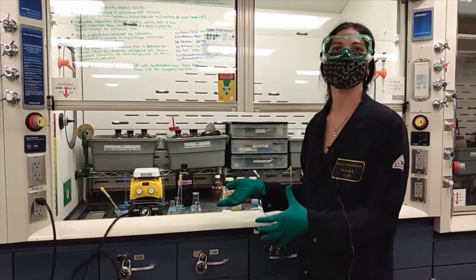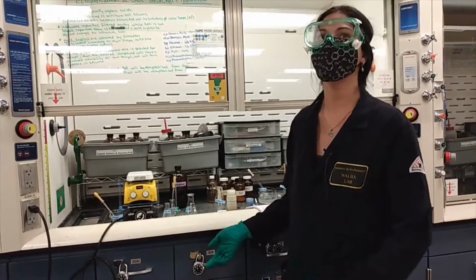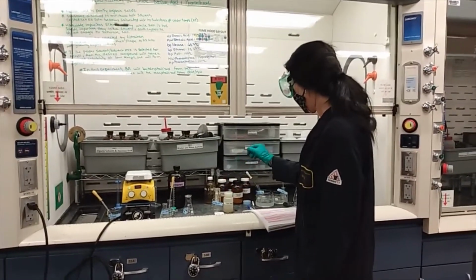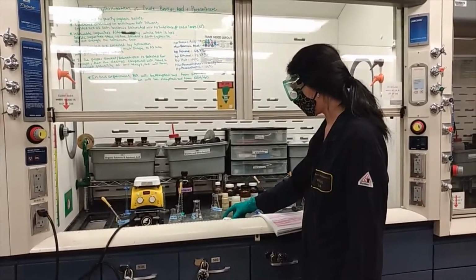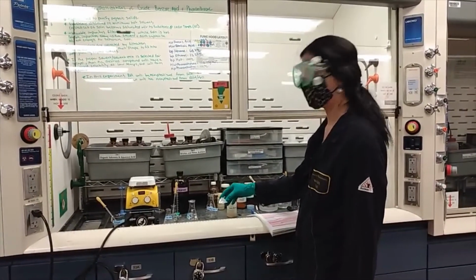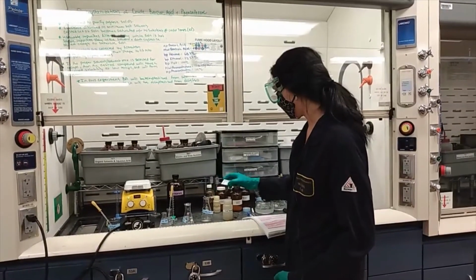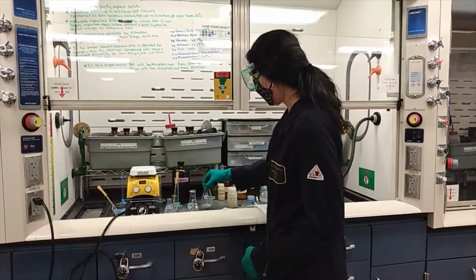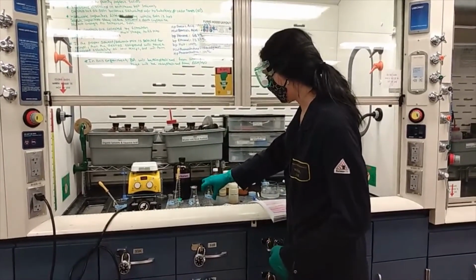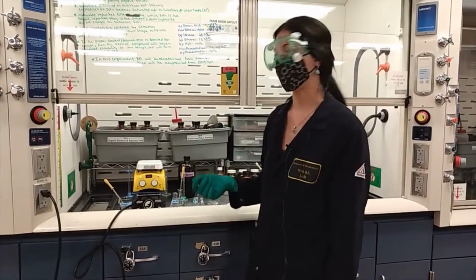While you're waiting for your benzoic acid to cool to room temperature, you can move on to the phenanthrene. Collect 0.1 grams of the phenanthrene that you isolated from last week's extraction lab and pour it directly into an Erlenmeyer flask, just as you did with the benzoic acid. But this time you're going to use a solvent mixture of ethanol and water rather than just hexane.